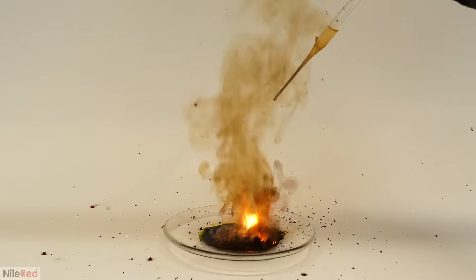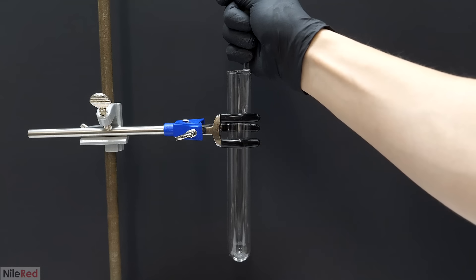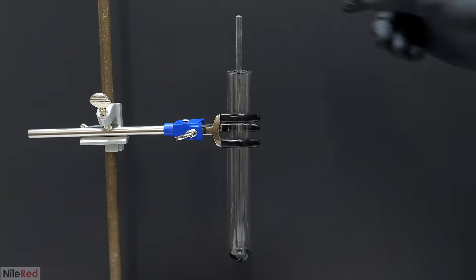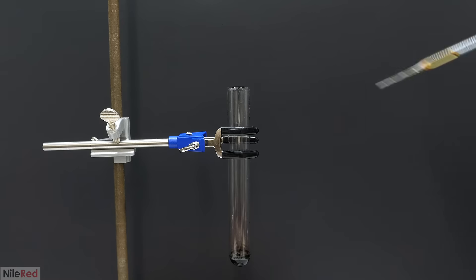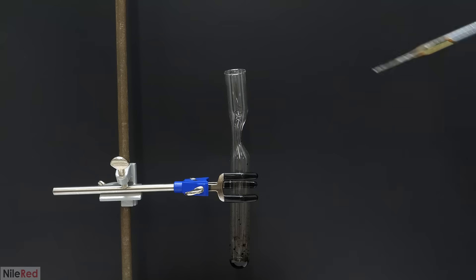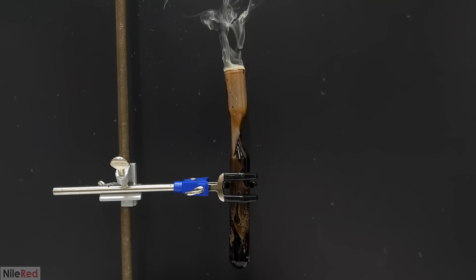Because the aniline seemed to be relatively tame, I decided I would try to fire it in a test tube like I did in my rocket video. To a test tube I carefully added some sulfuric acid followed by a small amount of permanganate — I figured it was better not to use the full gram and to do it a bit more dilute. This was all thoroughly mixed around and then I added the aniline. It seemed fine — meaning it didn't explode — so I tried it with a narrowed neck. The reaction there was a lot more violent and also pretty loud, though the full impact of the sound just wasn't picked up well by the mic.